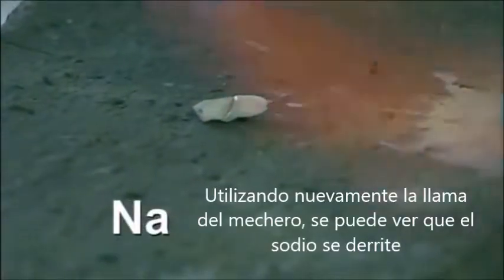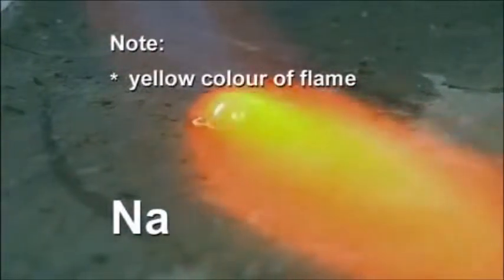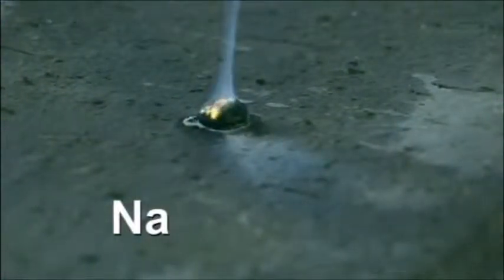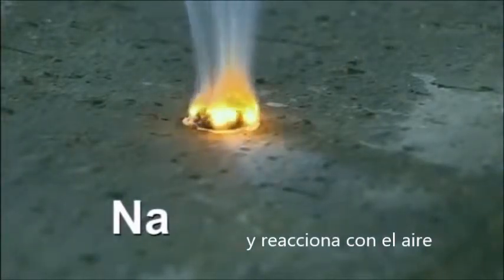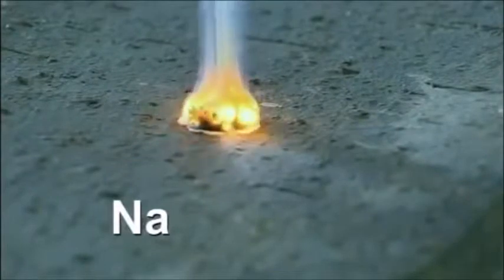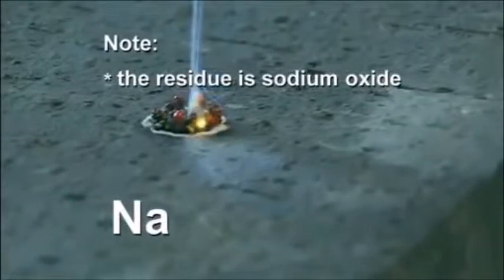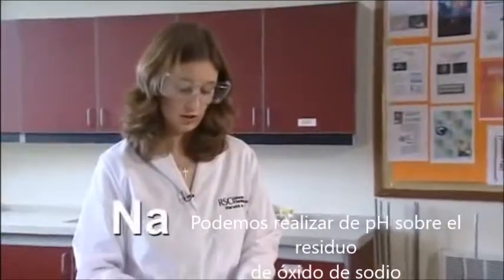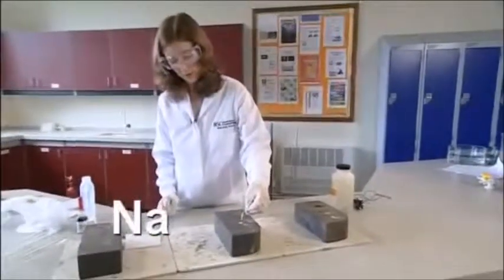Again with a roaring Bunsen flame. You see it melting. And reacting with the air. And again test the residue of sodium oxide with some moist indicator paper.